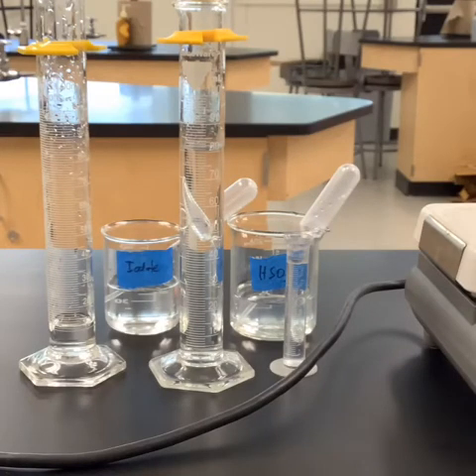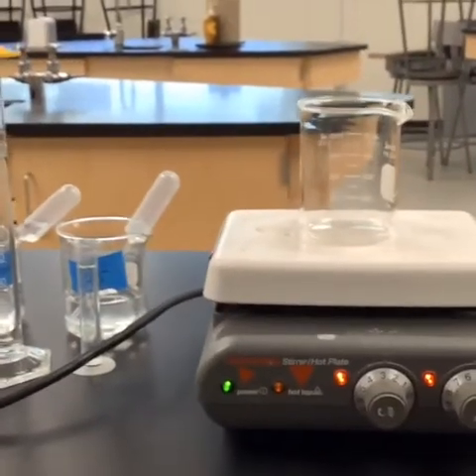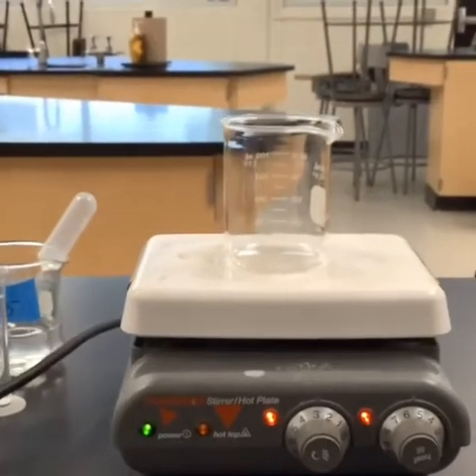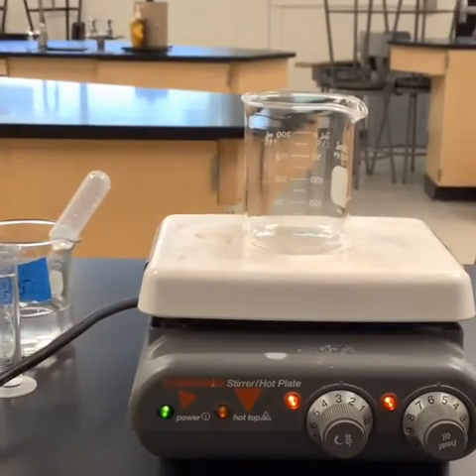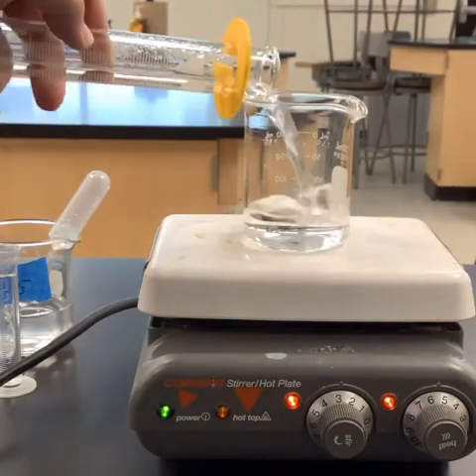So we're gonna go ahead and get all these things mixing, but I have to be really careful, and you guys have to be really careful on when you start and stop this. So let's scoot it over so we can get a better view of our beaker here. The order that we put it in doesn't really matter. So I'm gonna put the water in first to sort of give me some substance here. So I'm putting the water in.